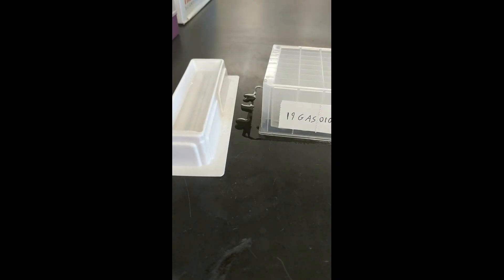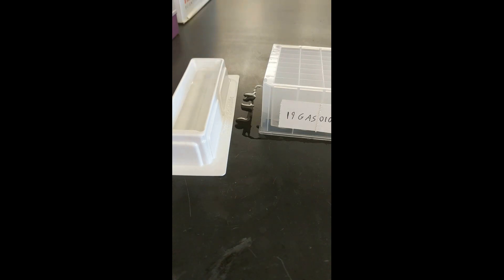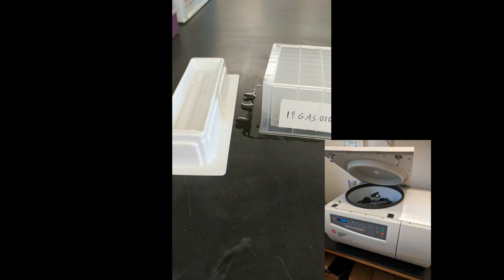We will then add 1200 microliters of 5 molar NaCl. Following this, you will allow the plate to rest for 15 minutes at 4 degrees Celsius and then centrifuge it for 15 minutes at 3600 RPM.